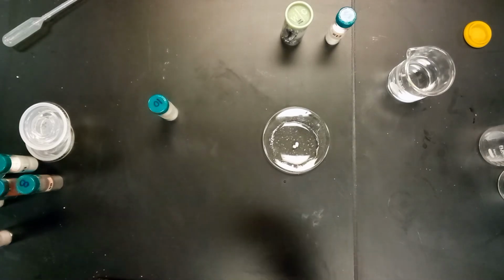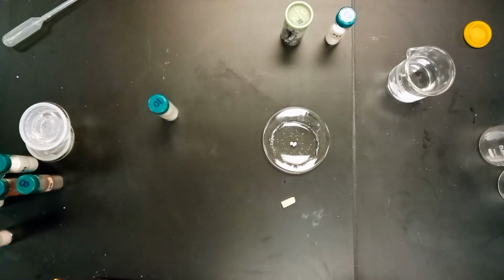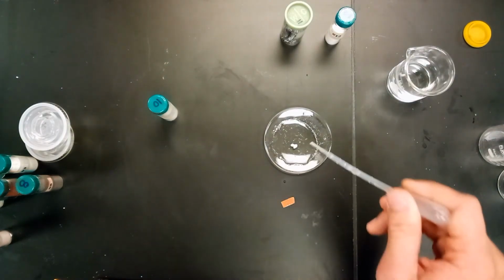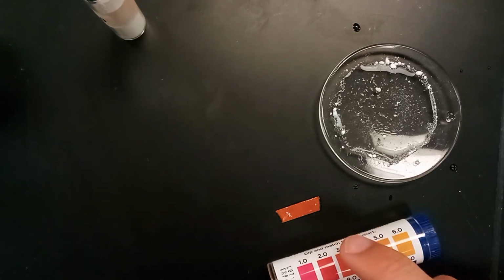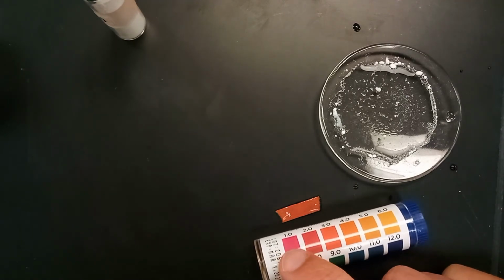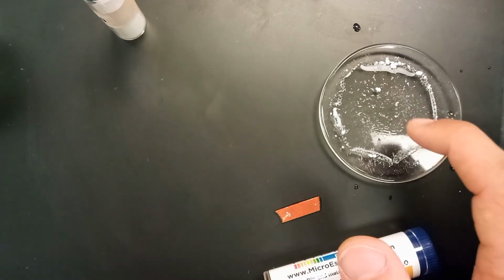So we'll take a piece of pH paper just to see if any of it's dissolved. Maybe it's only slightly soluble. So just grab a little bit of the solution and put it onto our pH paper. Okay, so after letting that one sit for a little while, you can see that's pretty dark. It's definitely not quite as rosy as a 1 might be, but it's probably somewhere in between a 2 or 3. So it's not super soluble, but what does dissolve is super acidic, if that's any indication. Yeah, pH somewhere around 2, maybe 3, 2.5, so yeah.